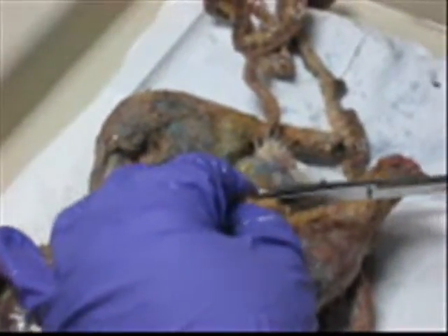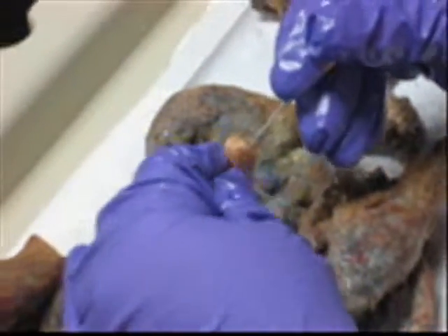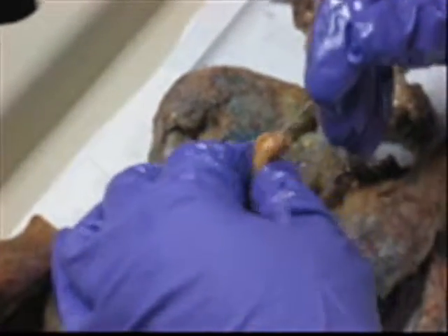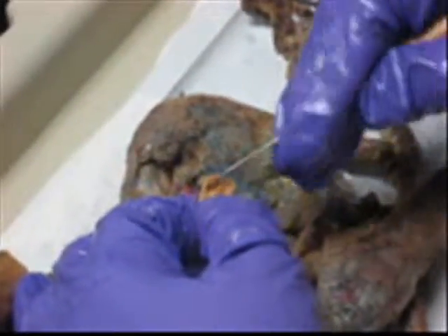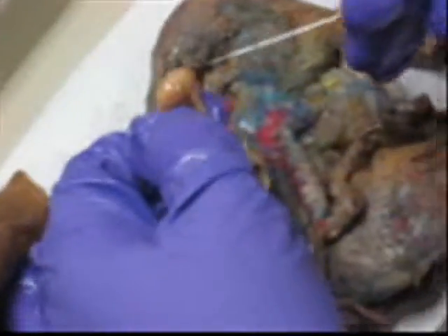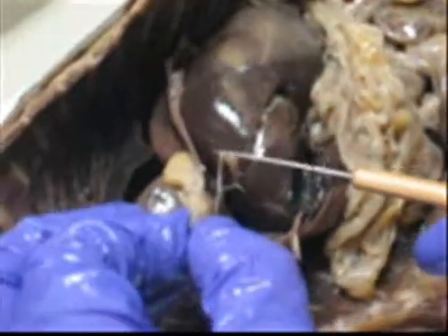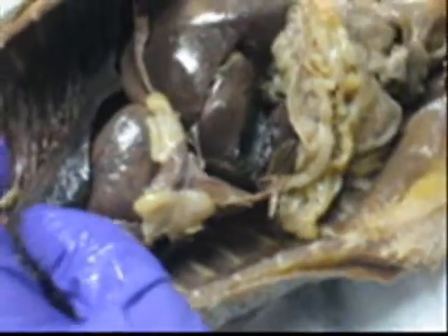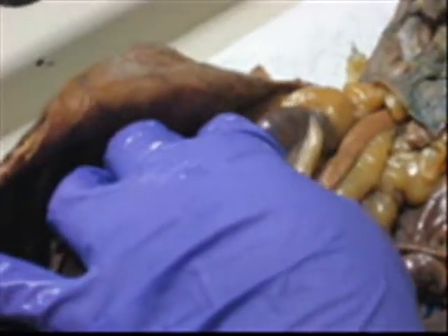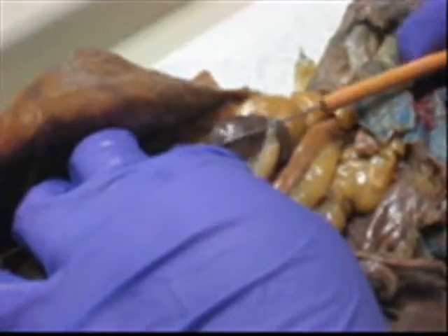Look at that. Inside the testicle is the seminiferous tubules. So you have epididymis, vas deferens, seminiferous tubules, spermatic cord. Layers, falciform ligament. And then this fat pad, and then capsule, renal capsule.